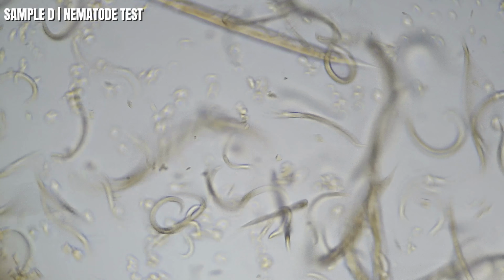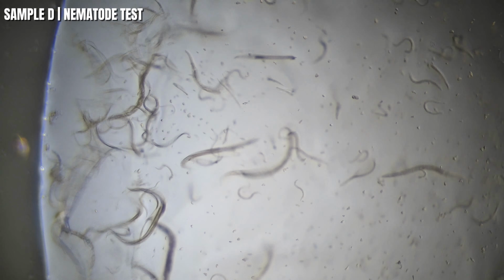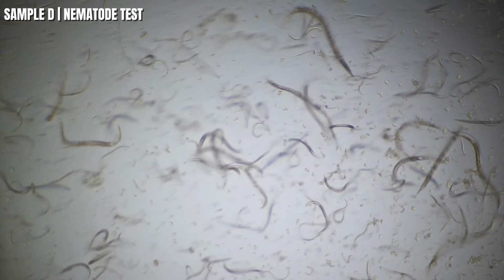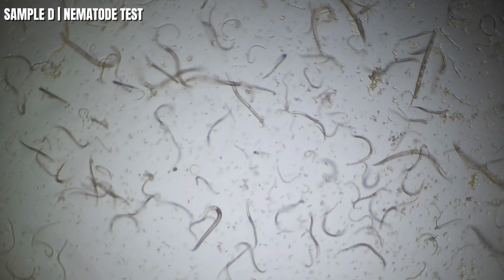So here we go, I'm gonna introduce sample D's whiskey. Let's take a look and see how they react. Look on your left side of the screen. There it is right there, guys. Wow, see that? That's a lot. It's like 1 million gallons of whiskey for them, but yeah, they got hit hard. So guess which one this is, sample D. And looks like they're doing okay so far, not too bad, but let's zoom in a little bit.